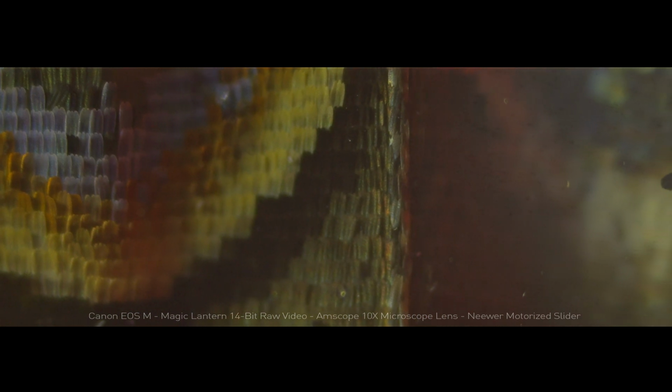Today, I will try to simply explain recording microscopic footage like this one by adapting microscope lenses to your digital camera, or using the whole microscope system for photography and videography.